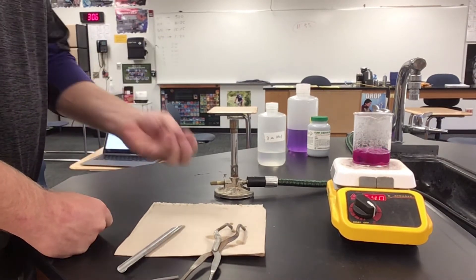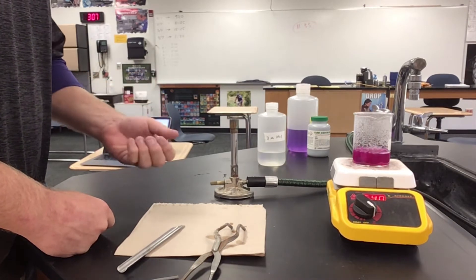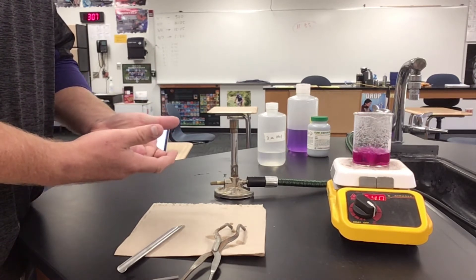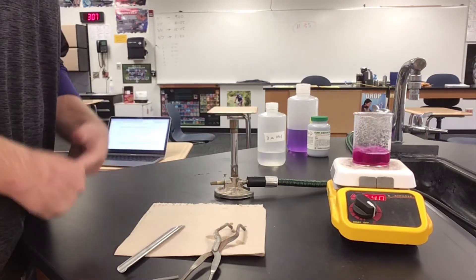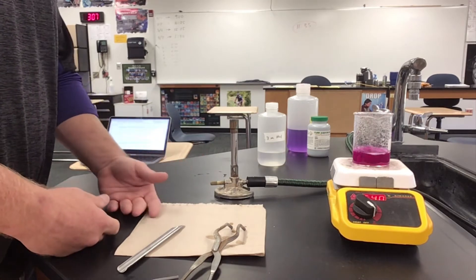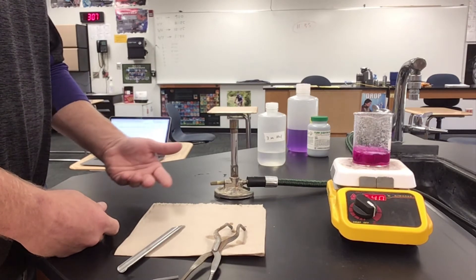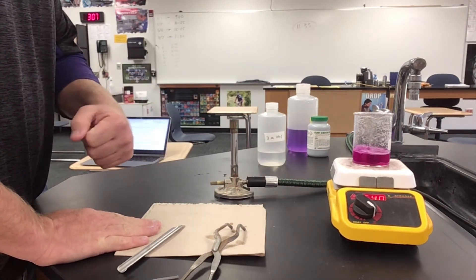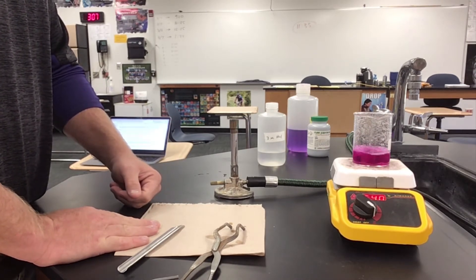This has to cook or boil for an additional three minutes. During this time, the sodium hydroxide base is attacking the zinc powder, and because we have high temperature at a boil, the zinc powder is creating zinc ions in solution. Because of an electrolytic imbalance, those zinc ions then attach themselves to the copper surface — this is called zinc plating. The parameters of this lab aren't to go through the chemistry behind zinc plating; the idea is to build the alloy. So as this boils for three minutes, we are essentially plating the zinc, taking it from solid powder into its ion state in solution and reattaching it as a surface coating on our pennies.